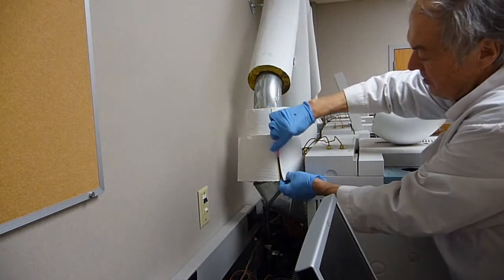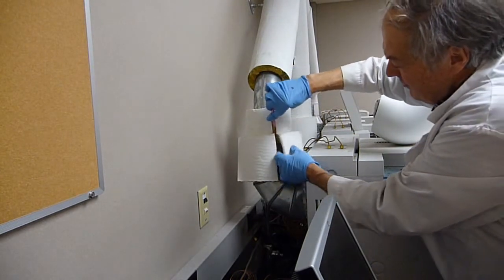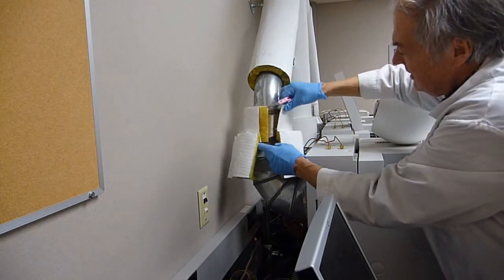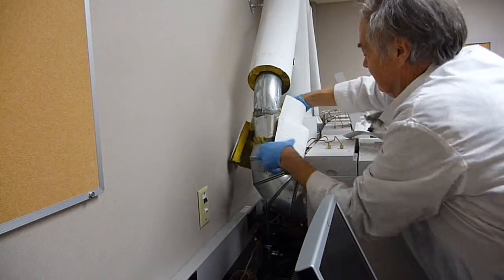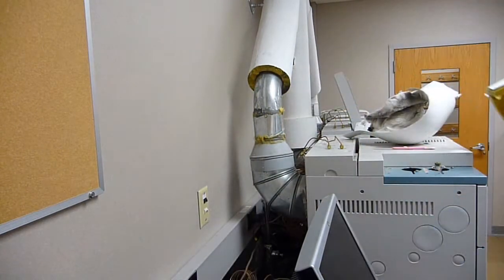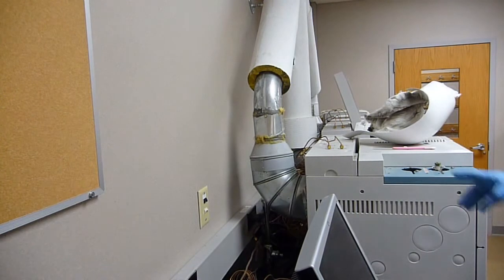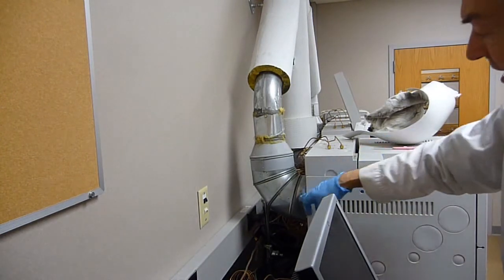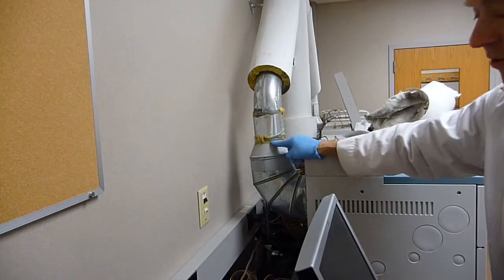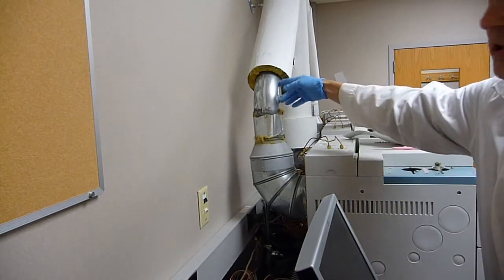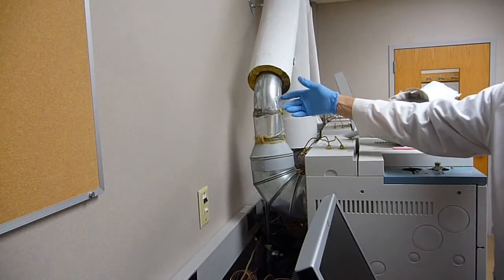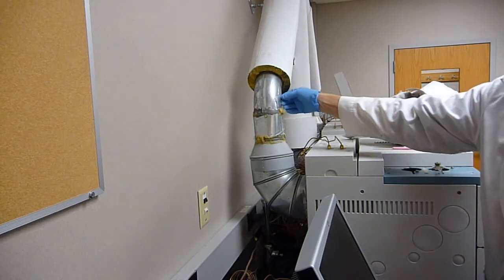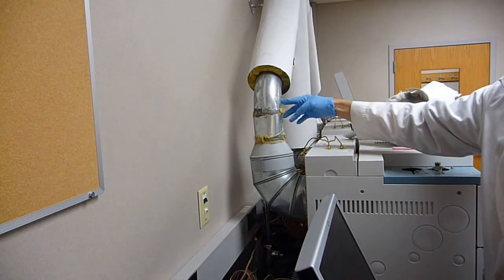Inexpensive box cutters used to slice the fiberglass insulation. Six inch elbow, six inch to four inch adapter, and then you run four inch tubing. It's an inexpensive setup. I call it tubing, if you were going to go to Lowe's or Home Depot, you would call it metal ductwork.